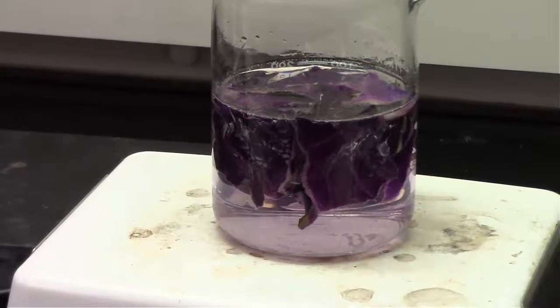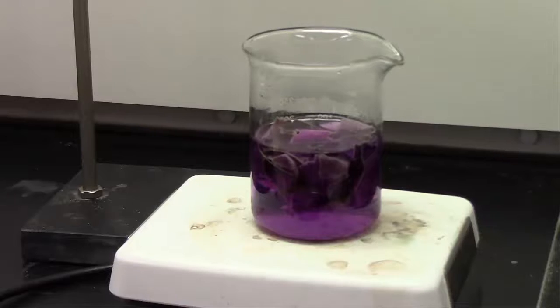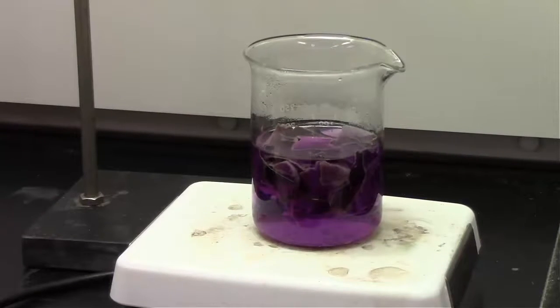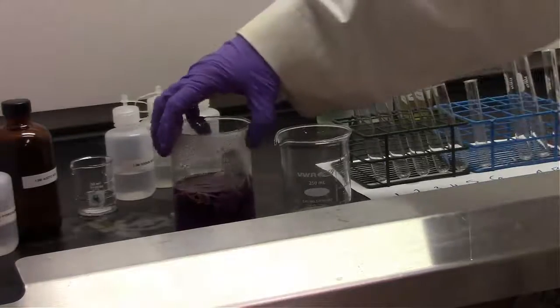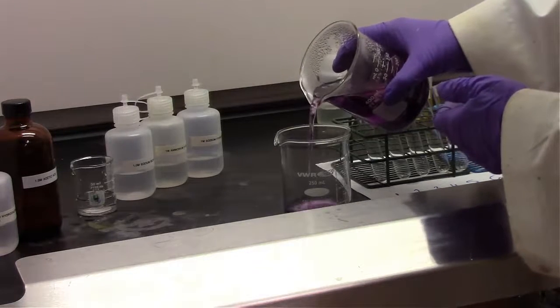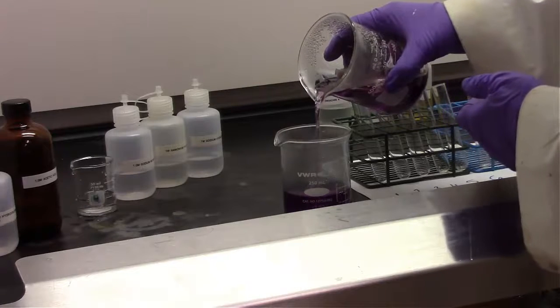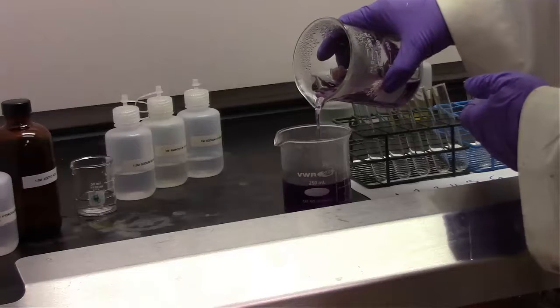And now you can see the solution starting to turn a little bit purple, and that means that we have our cyanidin 3-O-glucoside dissolving in that aqueous solution. Now the solution is turning even more purple, which means less of that cyanidin 3-O-glucoside is in the peel and more of it is in the solution, which means that we can isolate the solution from the red cabbage peel. That red cabbage peel is going to be slightly less red/purple because our cyanidin 3-O-glucoside is purple in color and we have now extracted it from the peel.